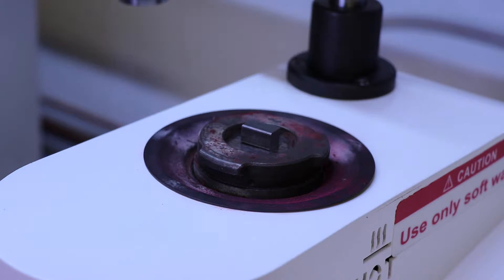When placing the sample onto the plate, the orientation doesn't matter, but just remember that whichever surface touches the plate, that is the side that will be exposed when the puck is complete.